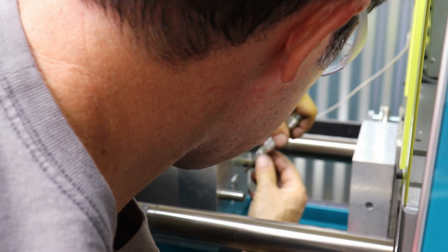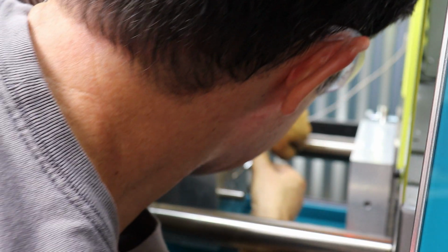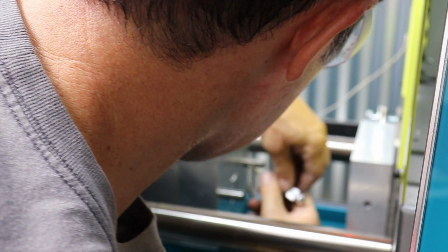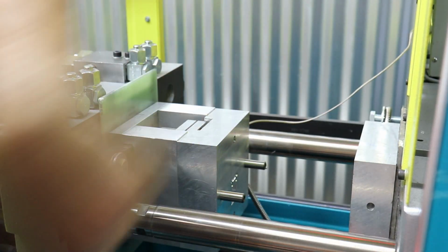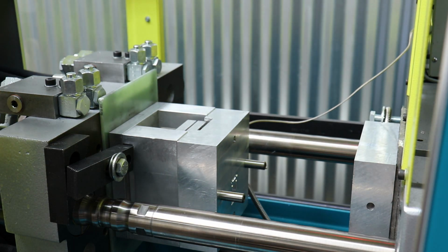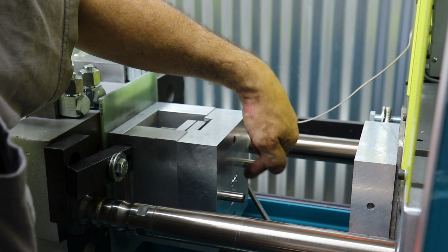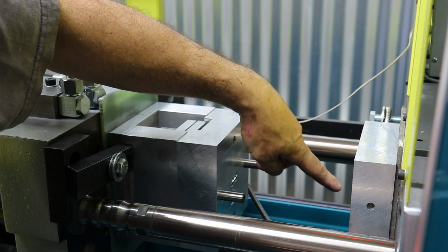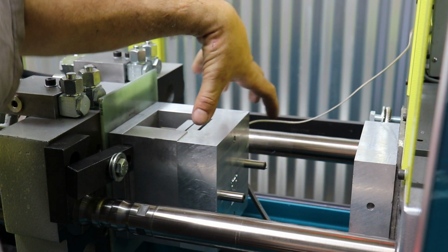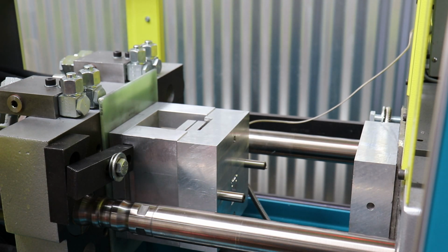So I put another detent there. Maybe I'll just add a couple more detents on the main sprue itself, because I don't want to mess around with the runners if I don't have to. Okay, so those little dents create an undercut. Those dents fill with plastic and it retains the sprue, and the idea is that the B side pulls the sprue and the part off of the A side. So let's see if that actually worked.